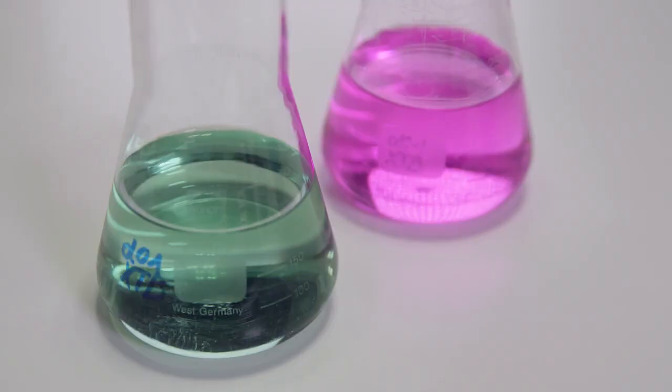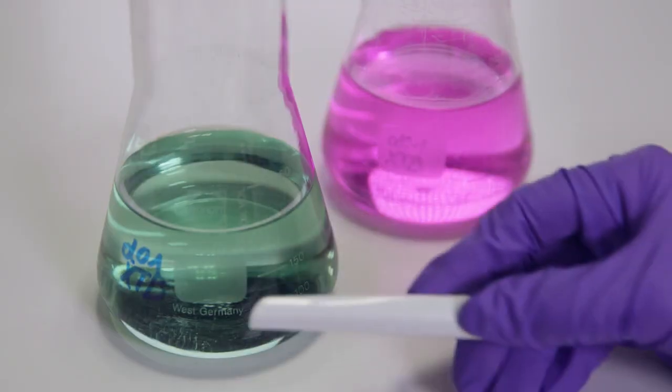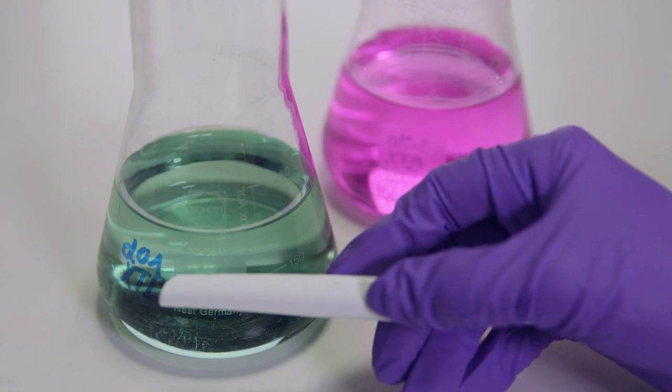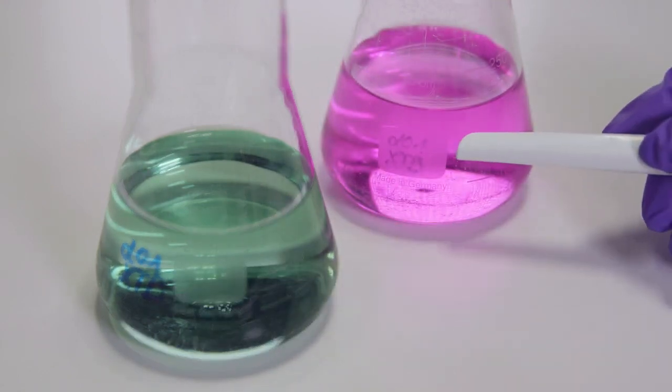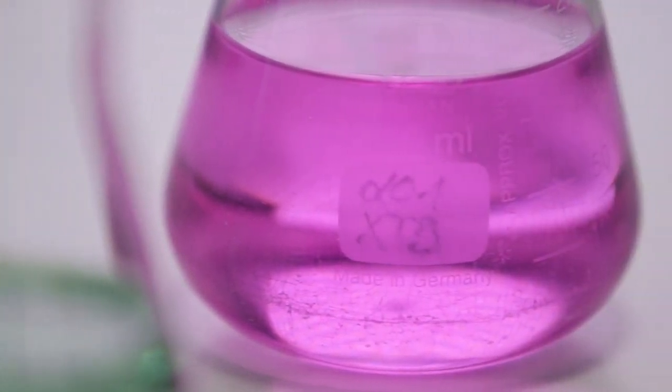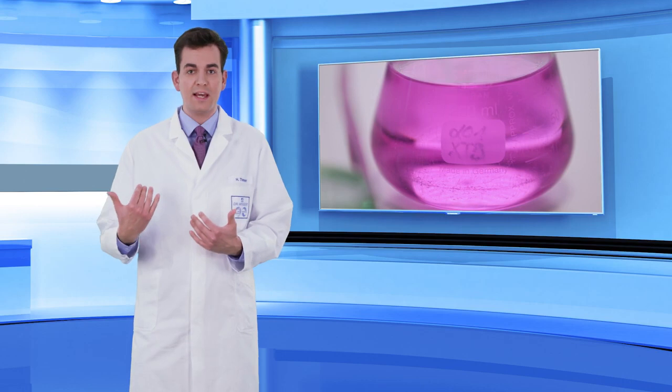Second, with older laboratory glassware, you should always mark the glass directly rather than the ceramic surface provided for this purpose. The rough ceramic layer absorbs colour pigments, which makes them more difficult to remove.